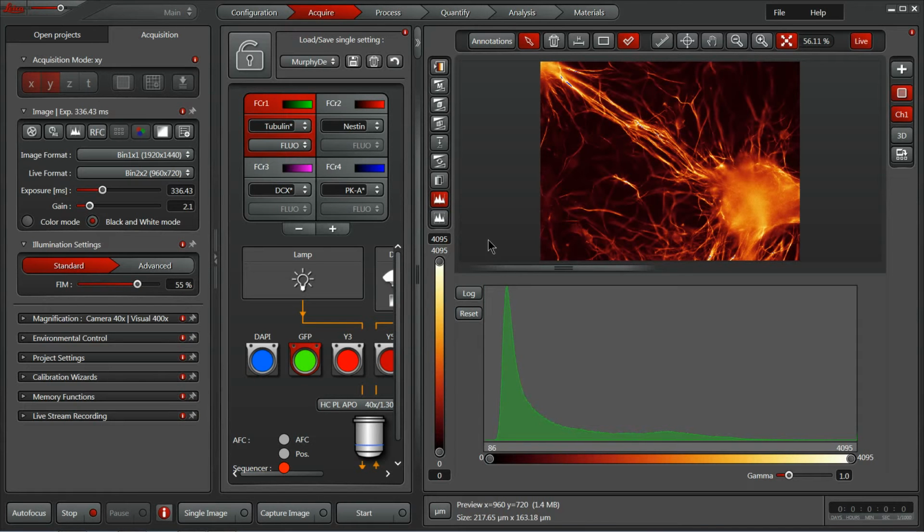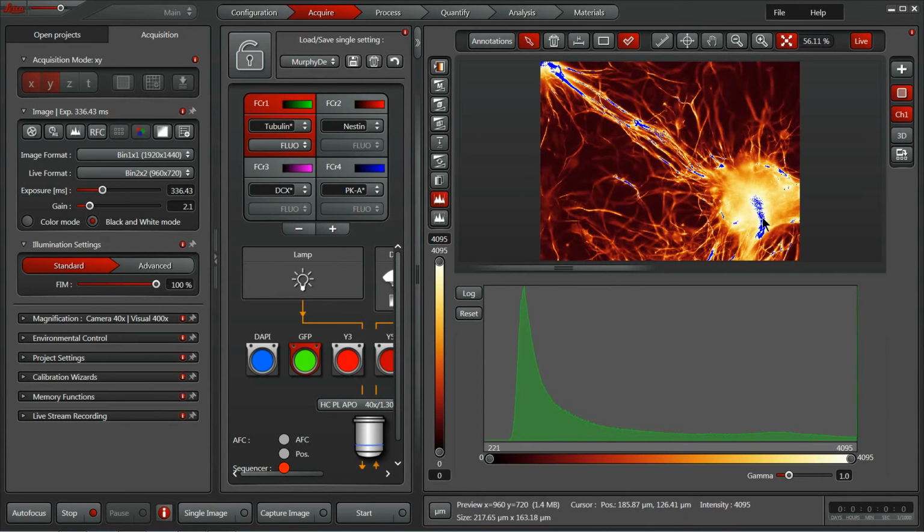Now let's look at the histogram in conjunction with my personal favorite way of setting my exposure time, altering the lookup table from a pseudo color of green or a raw grayscale into this heat map. So the heat map gives us the same information about our fill within each pixel using an easier to see variation of colors as it goes through our reds into oranges, yellows, and whites. Our eyes can pick out a little clearer the variation in intensity. And in this case, we also get this beautiful blue indicator of saturation. So if I maximize the number of photons going into the system, we see these huge areas displayed in blue are our saturated pixels, where the pixels are just overflowing with electrons.